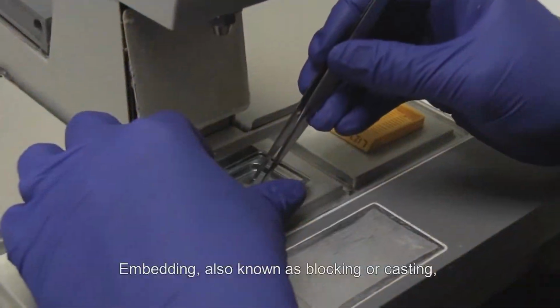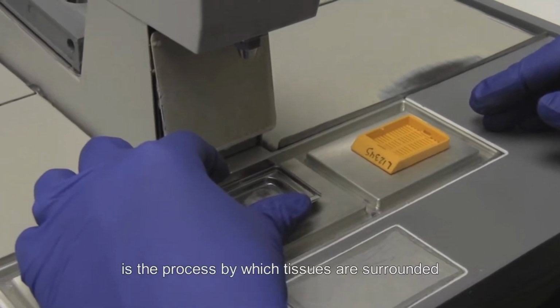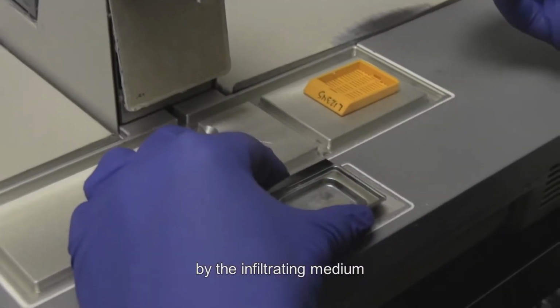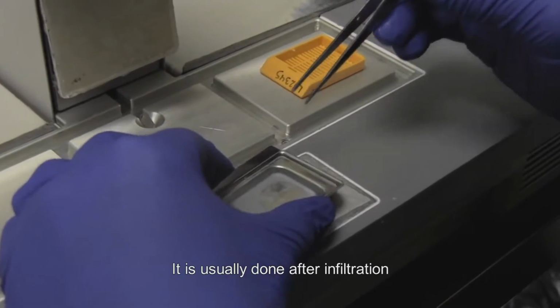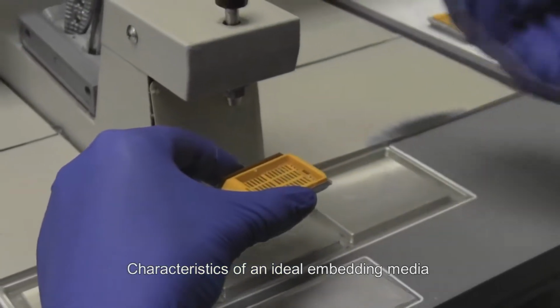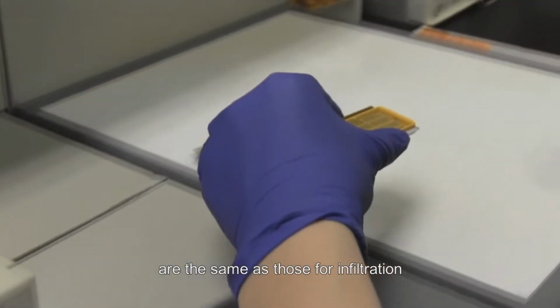Embedding. Embedding, also known as blocking or casting, is the process by which tissues are surrounded by the infiltrating medium, which, when solidified, provides sufficient external support during sectioning. It is usually done after infiltration. Characteristics of an ideal embedding media are the same as those for infiltration.